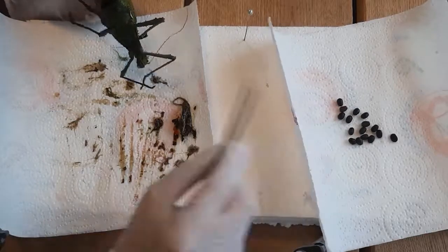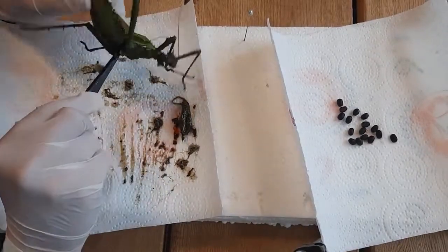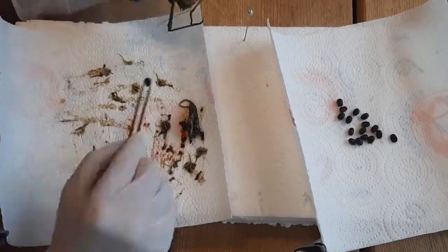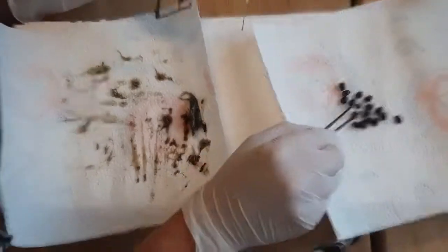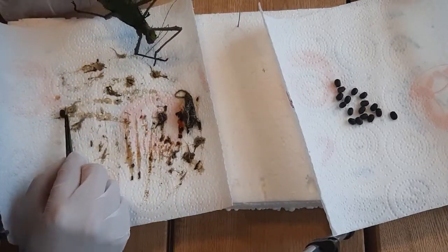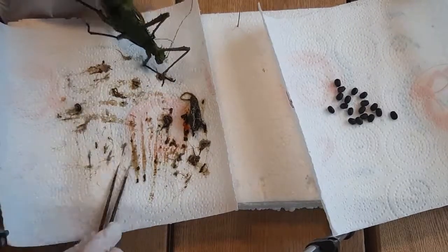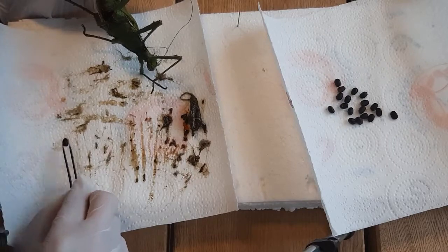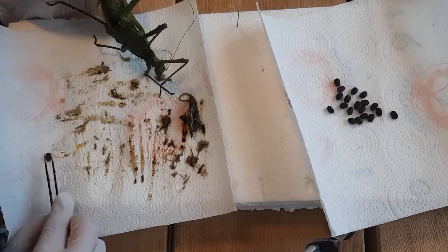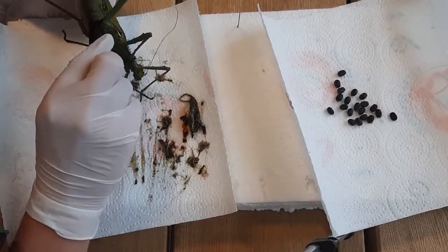You might also find some unfertilized eggs in the insect. These look red — they are also round and big, but they are red. They are still developing the outside of the egg. You can still collect those and put them in ethanol, for example — it's a really cool display piece. You need to be even more careful, and with this method you will break most of them. But in my collection I have underdeveloped eggs from nine species, and it's a really cool addition to show visitors in the museum.